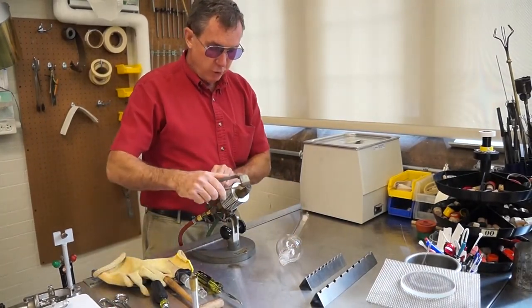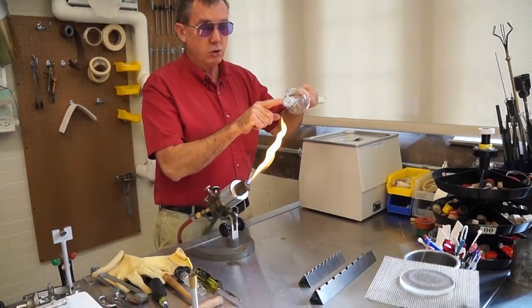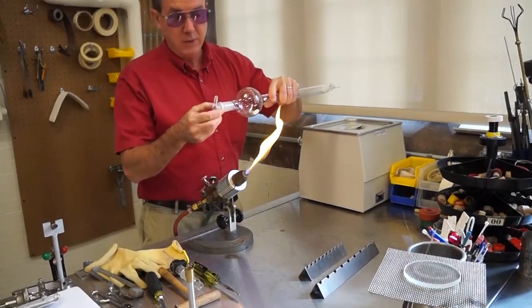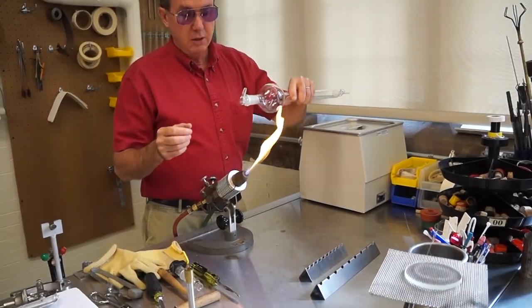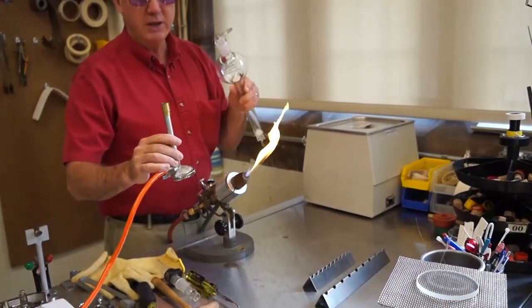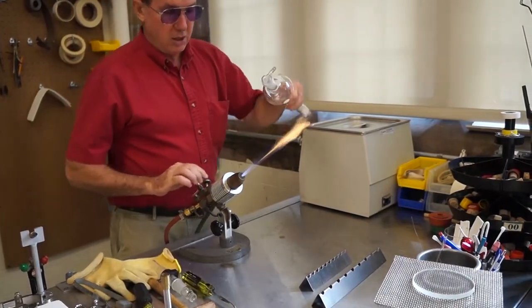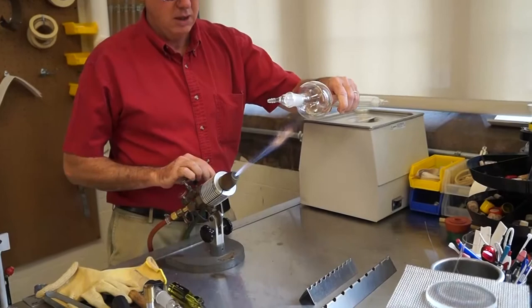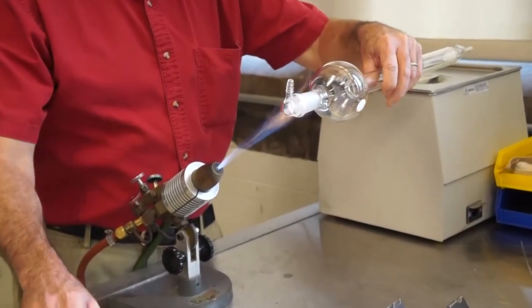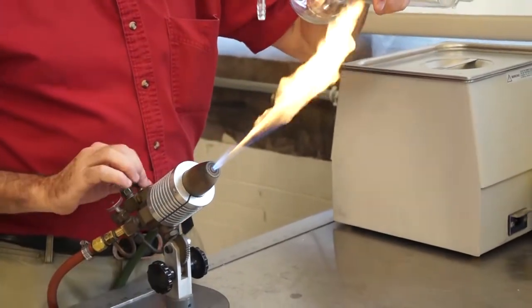The next thing we'll do is we will take and we'll apply some heat. Now the idea is that we heat up the outer joint. It expands quicker than the inside joint and then it'll release. You have to heat it quickly. You could try in the lab using your Bunsen burner, but that's not hot enough. So we will take this and we will get a nice hot fire and actually heat up the outer joint very quickly and it will come out quite easy like that.